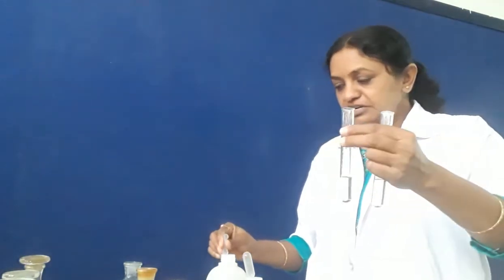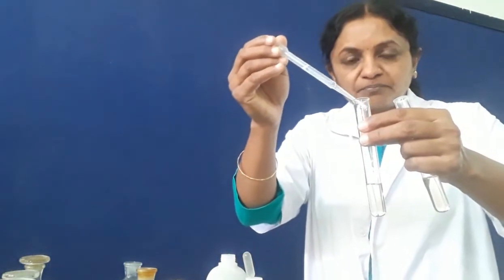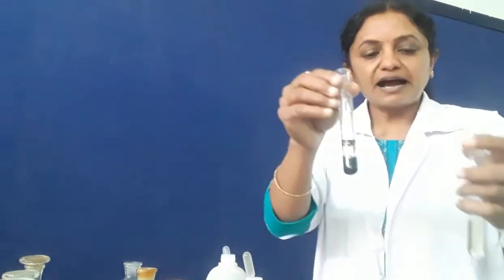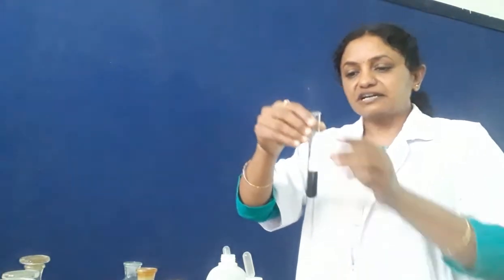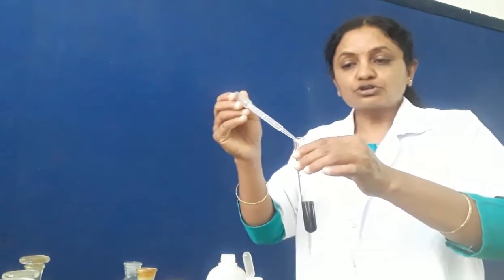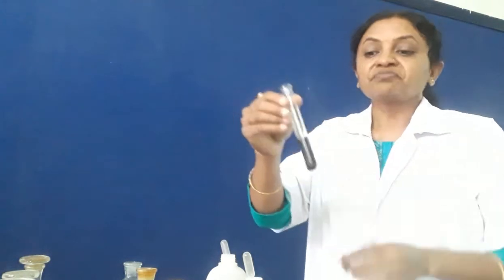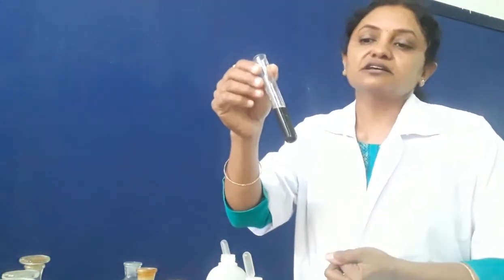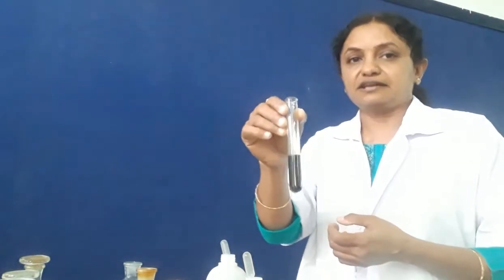In the first test tube, we add a little amount of NaOH — sodium hydroxide. When you add it in a little amount we are getting a dirty green precipitate. On adding excess NaOH, we again see the same thing: dirty green precipitate, and the precipitate is insoluble in excess.